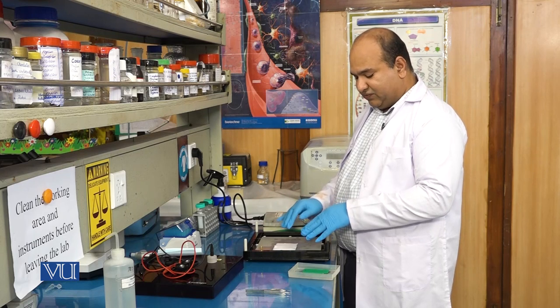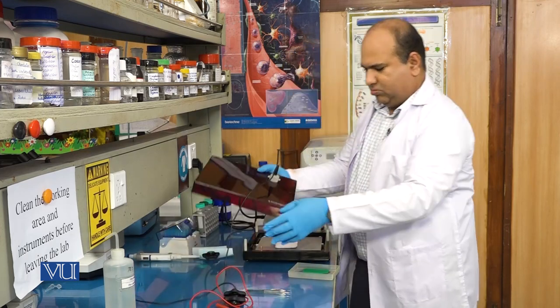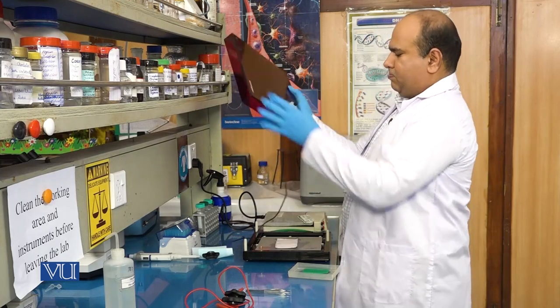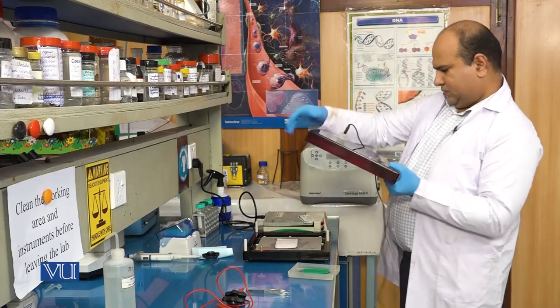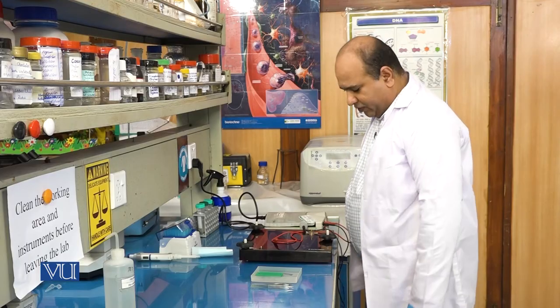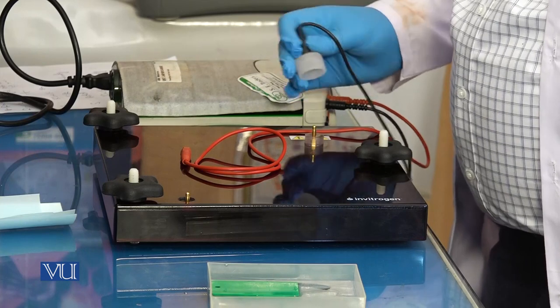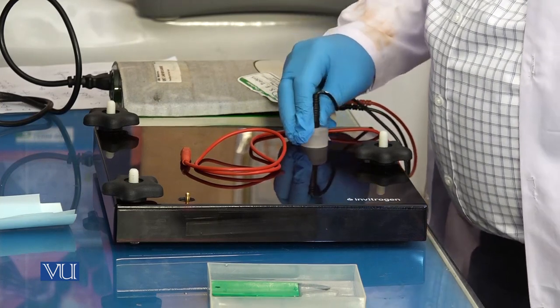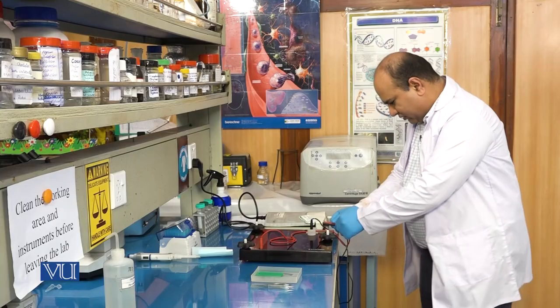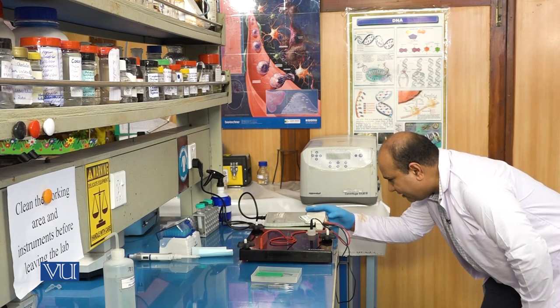Now we will run the transfer. This is the lid which we have to put over this machine. Now we will connect the electrical terminals — you have to be careful so that the positive electrode is connected to positive and the negative to negative. Now we will adjust the voltage; I put the voltage on 20 and I put the time on 30 minutes.